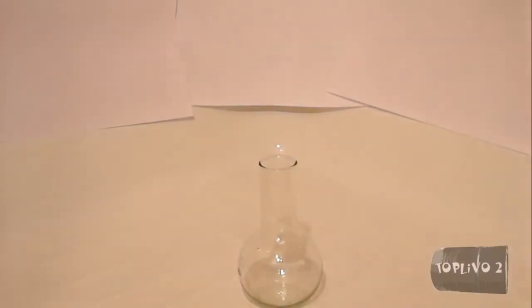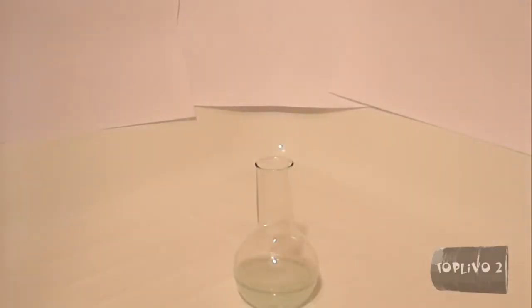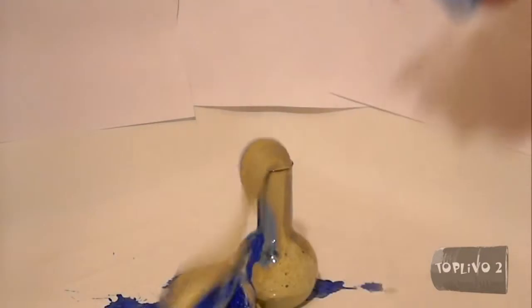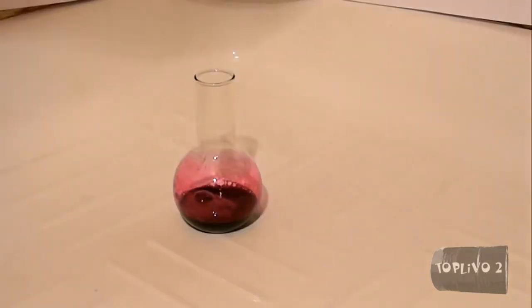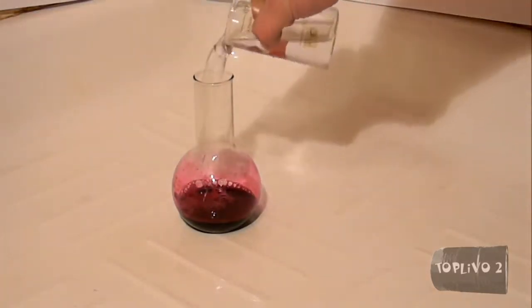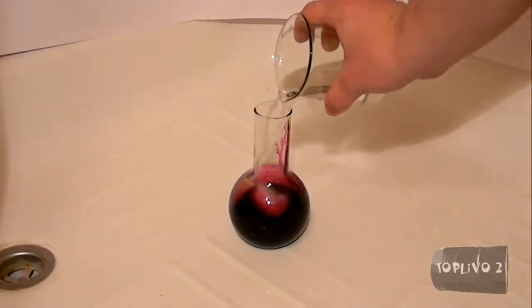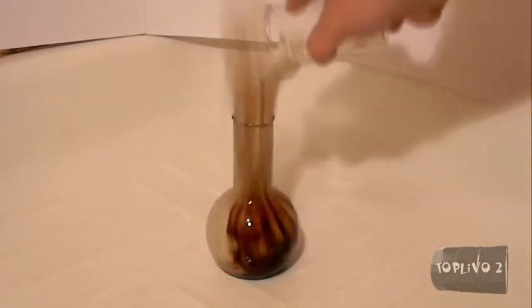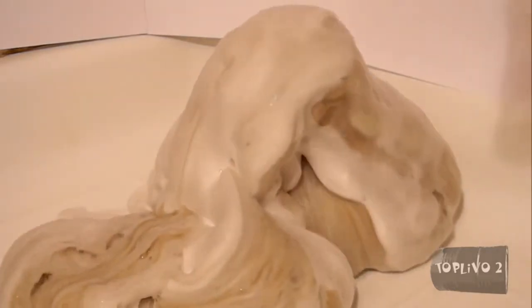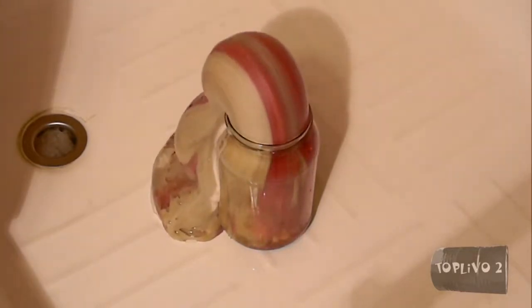Every time the reaction proceeds a little bit differently, so I'll show you some of my takes. First cut: I used copper ammoniate as a catalyst. Second cut: a solution of potassium permanganate as a catalyst. Third: same potassium permanganate. Fourth: the same. Fifth: this one I decided to make in a glass jar — in essence, nothing has changed.